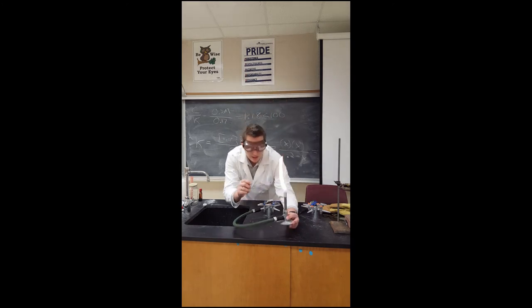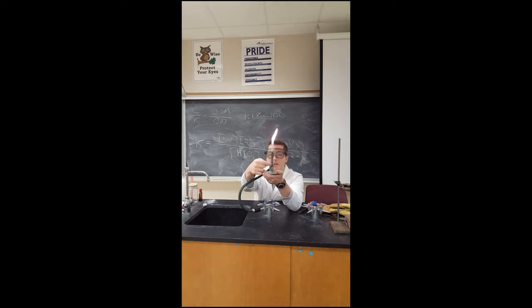You can also adjust the amount of oxygen going into that flame. The flame is yellow right now, and that signifies it's not burning as hot as it could. To get more complete, hotter combustion, we're going to unscrew the collar a little bit. Notice how it's turning blue. The more I unscrew it, you can see the inner cone — that's what we call the blue flame of death, the stuff that's going to melt metal. We can actually adjust the flame temperature by adjusting the amount of oxygen going to the flame.